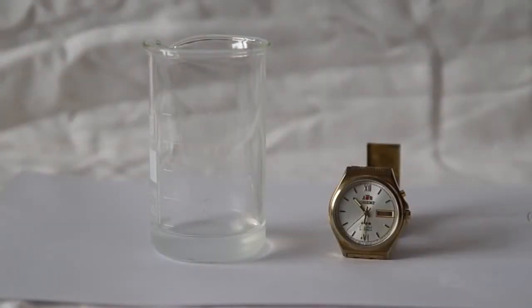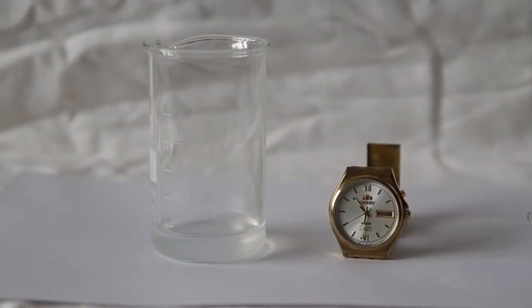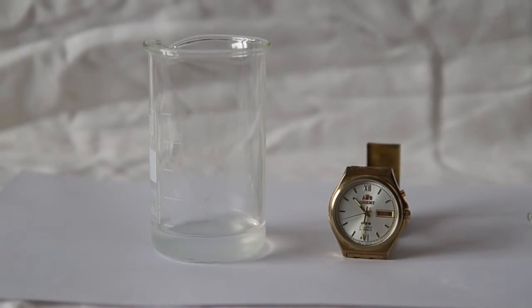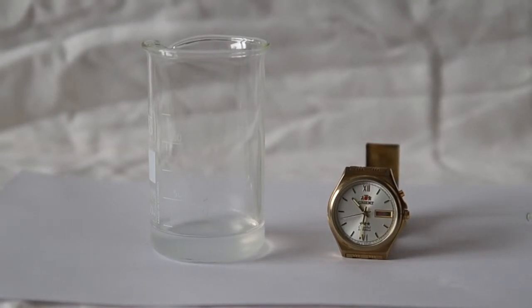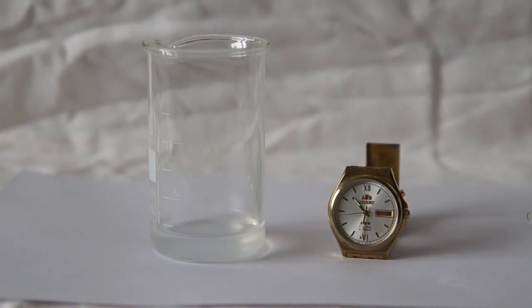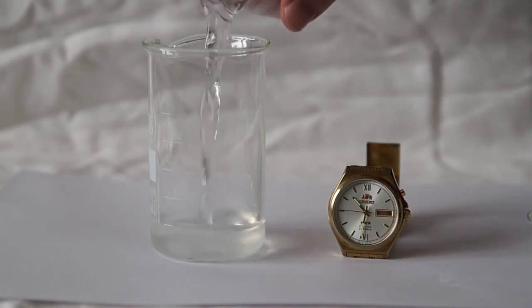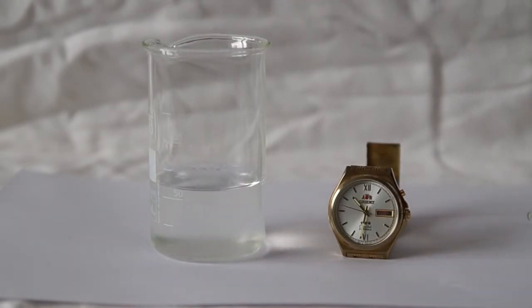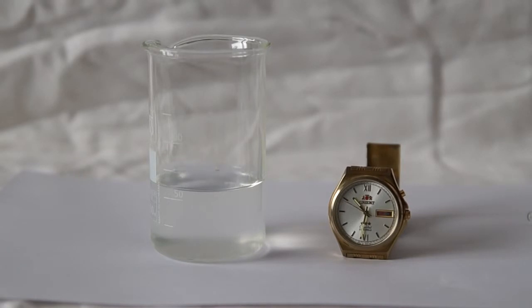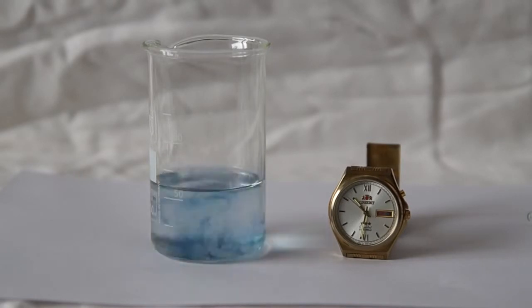We now carry out the reaction. I set the clock so you can see how the reaction occurs. In the main beaker I poured 20 milliliters of the first working solution, and now I am pouring the second working solution into the beaker. Time passes and the solution rapidly becomes black.